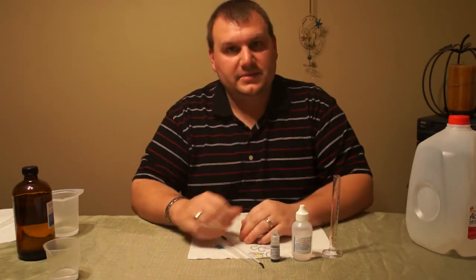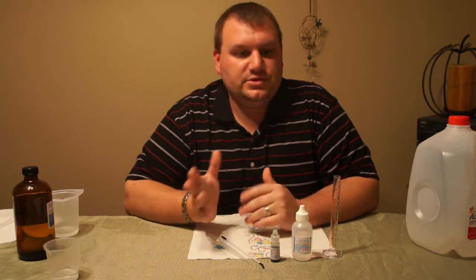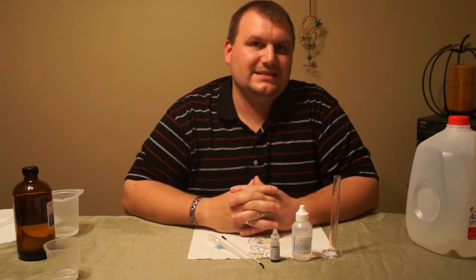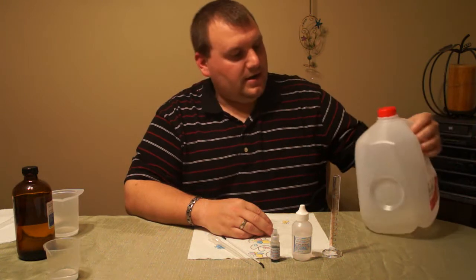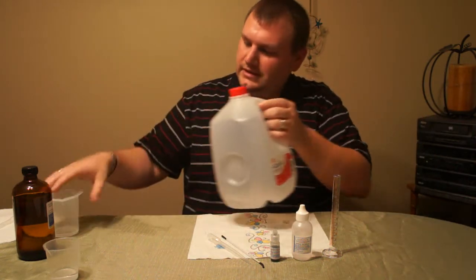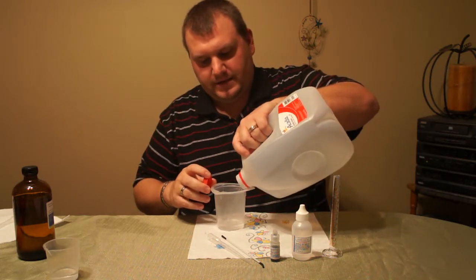These supplies can be gotten at www.eliquidtest.com, along with these testing procedures, some tips, tricks, and actually some alternate testing methods. Your distilled water can be gotten at your local grocery store. It's cheap, about $1.50 a gallon or so. And it does need to be distilled — it can't be boiled water or filtered water or anything like that.